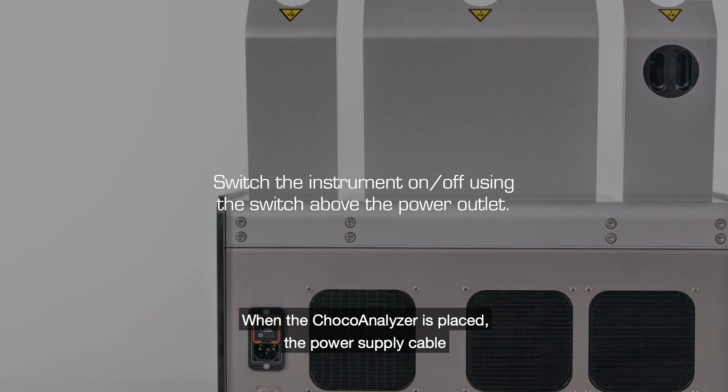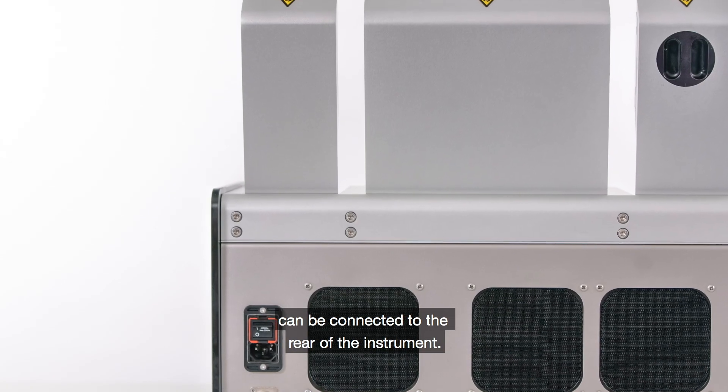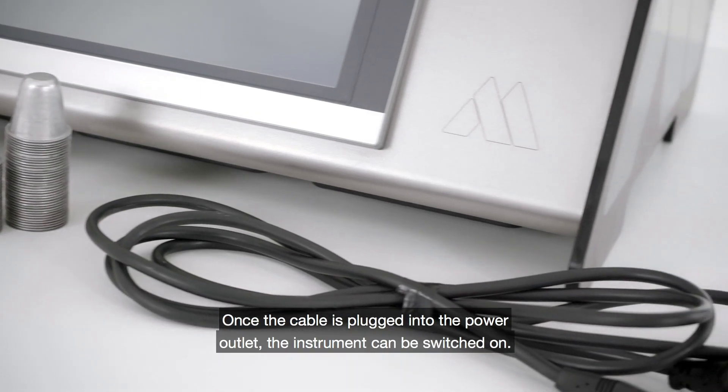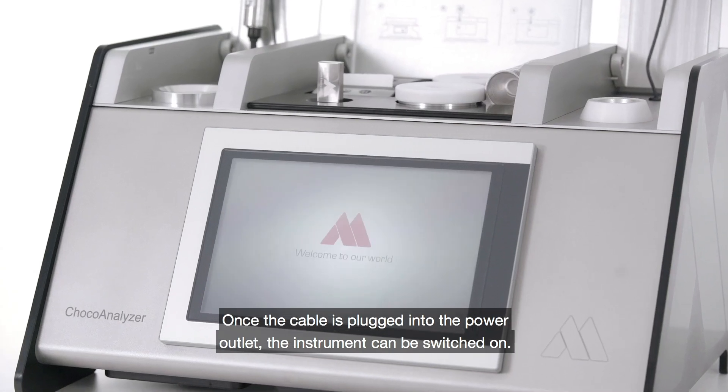When the ChocoAnalyzer is placed, the power supply cable can be connected to the rear of the instrument. Once the cable is plugged into the power outlet, the instrument can be switched on.